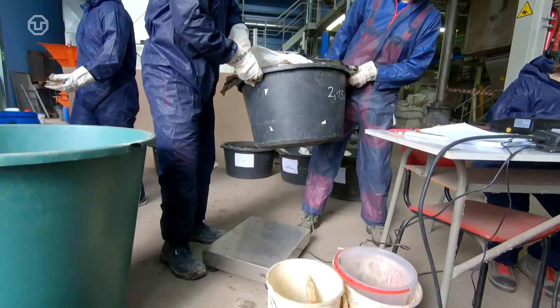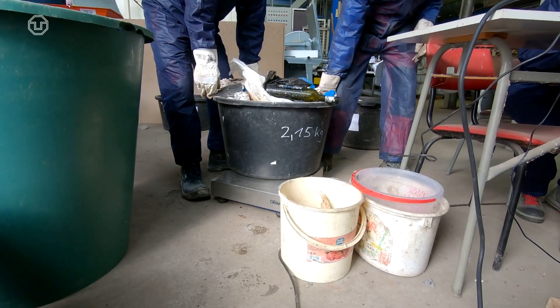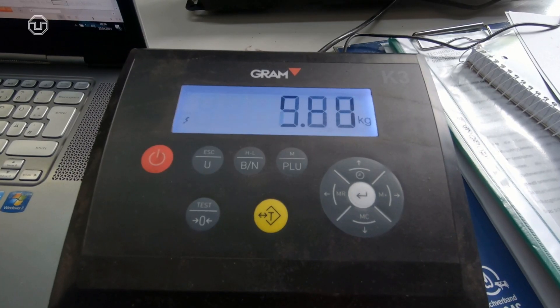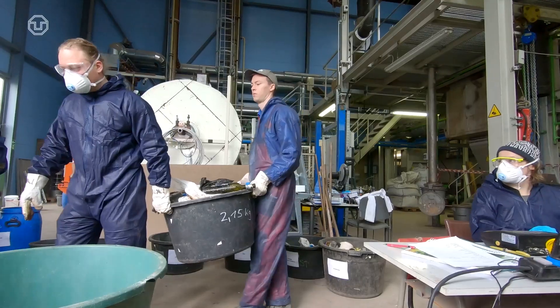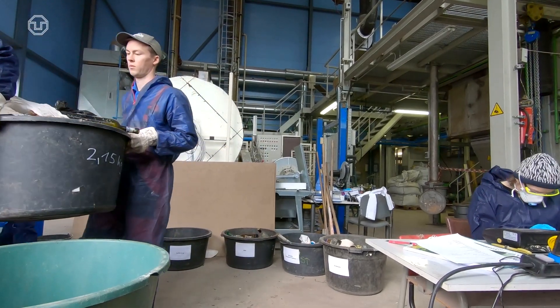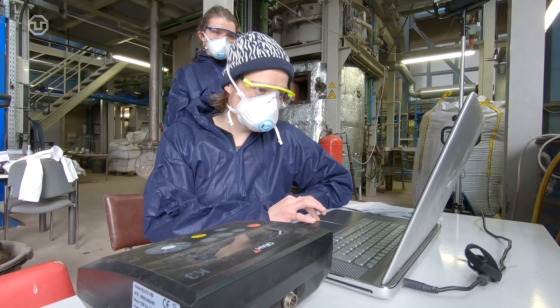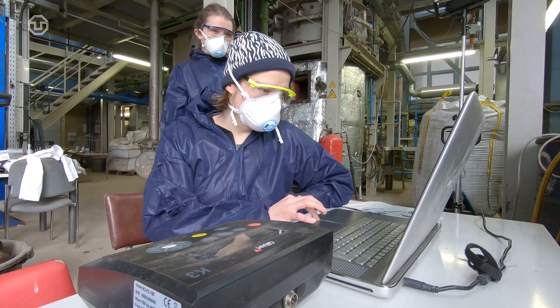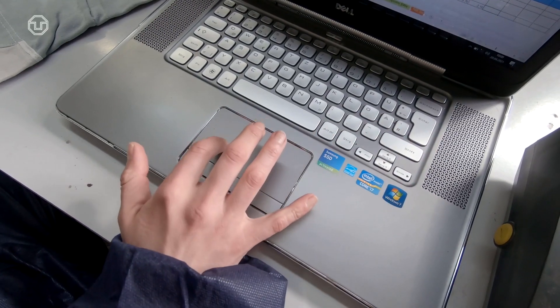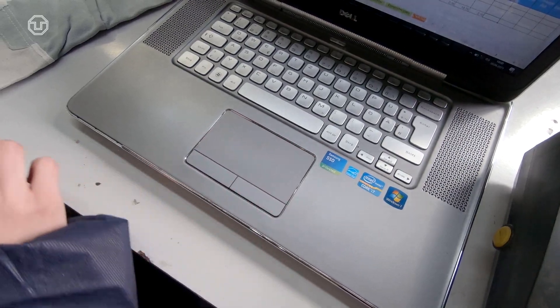As soon as sufficient waste material has accumulated, its weight is determined. The empty weight of the container must be taken into account. The percentage of the respective fractions of the total weight is then determined from the obtained raw data.